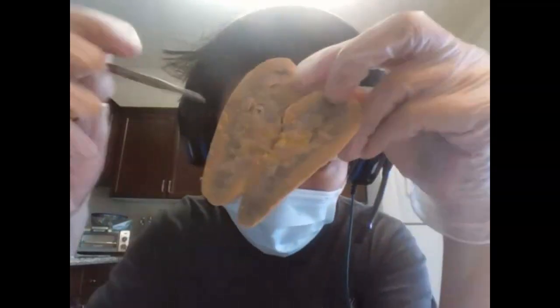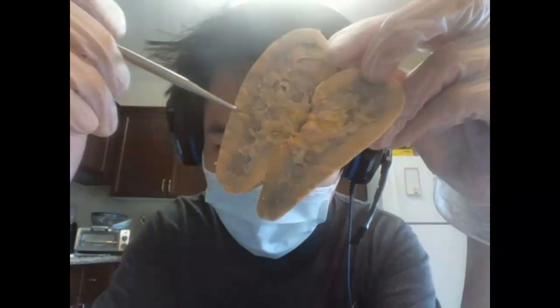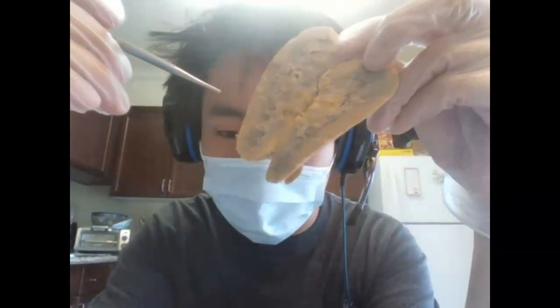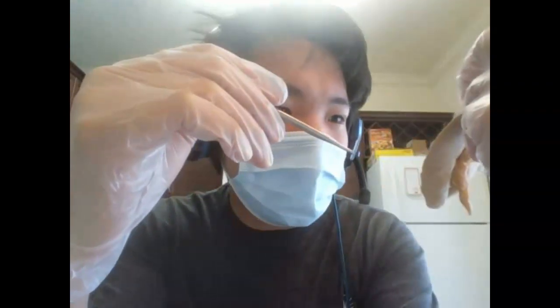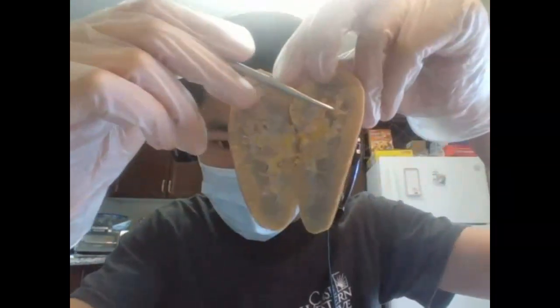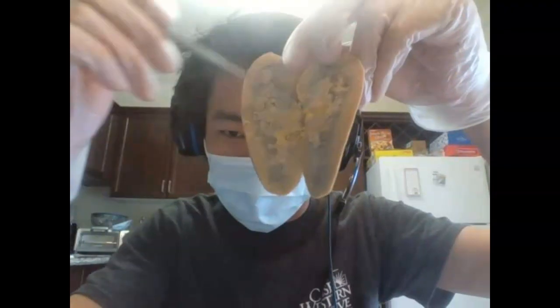And speaking of that, there's a lot of yellow stuff right here you might notice. This yellow stuff is actually calcified urine. The reason I determined that was because I thought it was adipose tissue, but I also did some research on that, and adipose tissue is actually more clear substances surrounding the blood vessel.